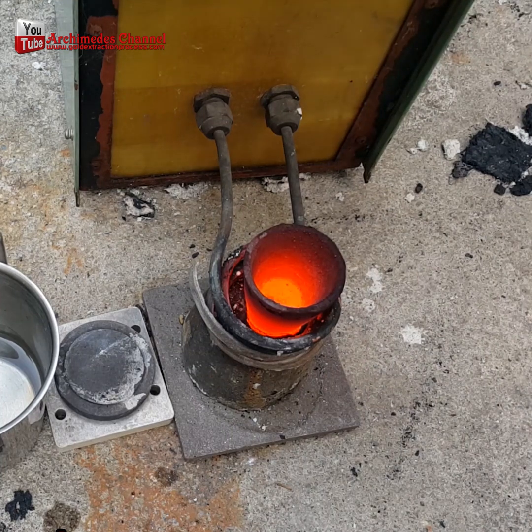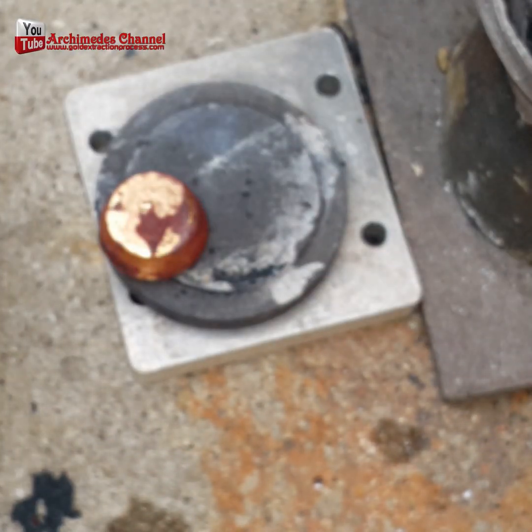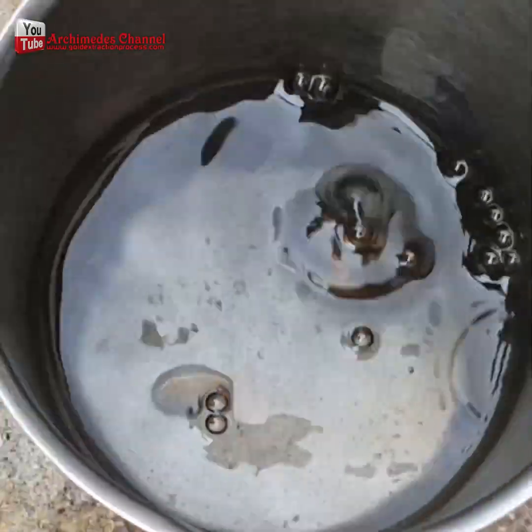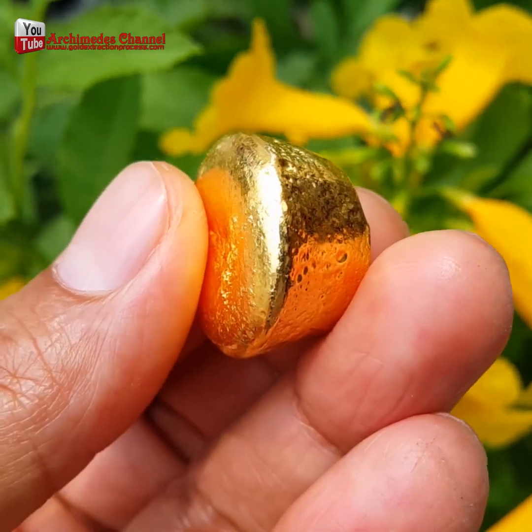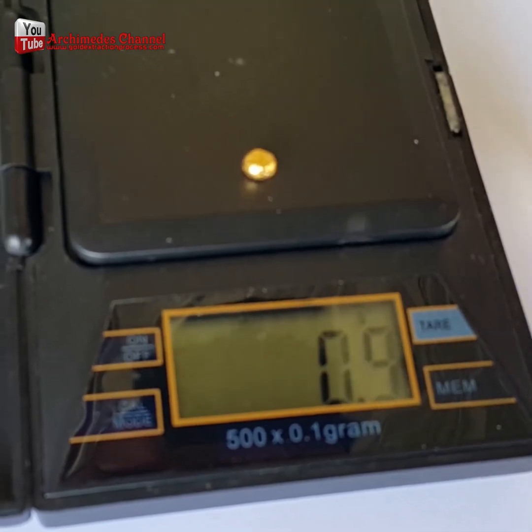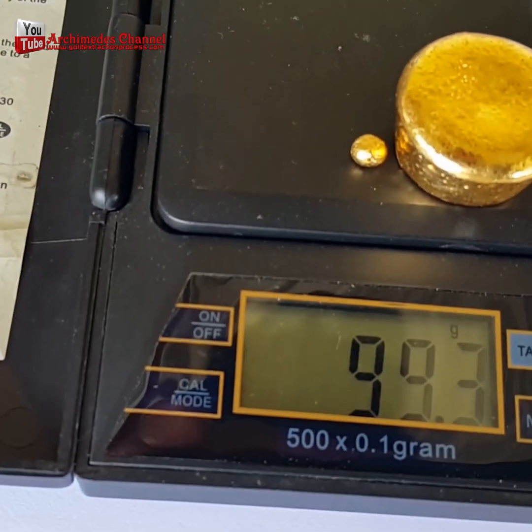Just a pinch. Then carefully remove it and allow it to cool before it's tapped out. And check that out.